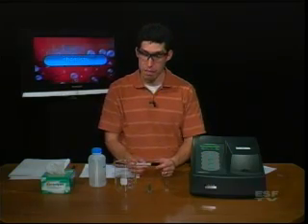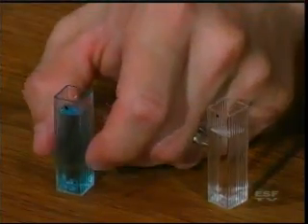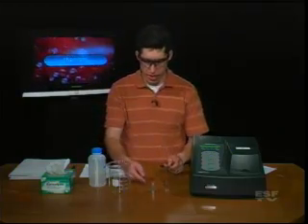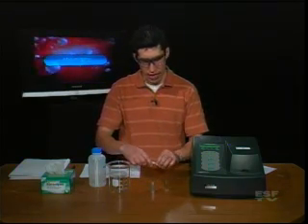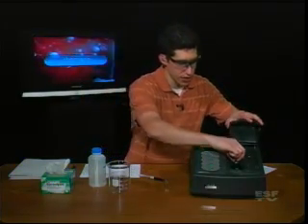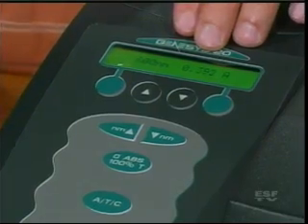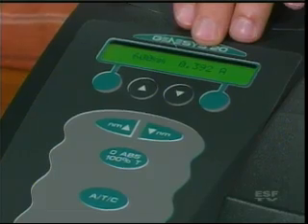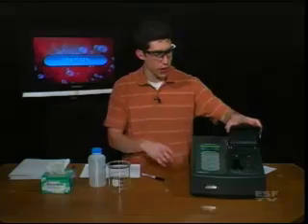So I'm going to take my marker again and mark the other cuvette so I know which way it's going to face out, and I'm going to make that little mark there. You don't have to worry about it being in the way because the light on the cuvette actually hits around the bottom half or so, so as long as the dot is at the top, we're okay. I'm going to put my cuvette in the spectrometer, insert it into the chamber, close the cover, and we can measure the absorbance as 0.392. It's a very stable number, and we can record that in our notebook for future use and use Beer's Law to determine concentrations.